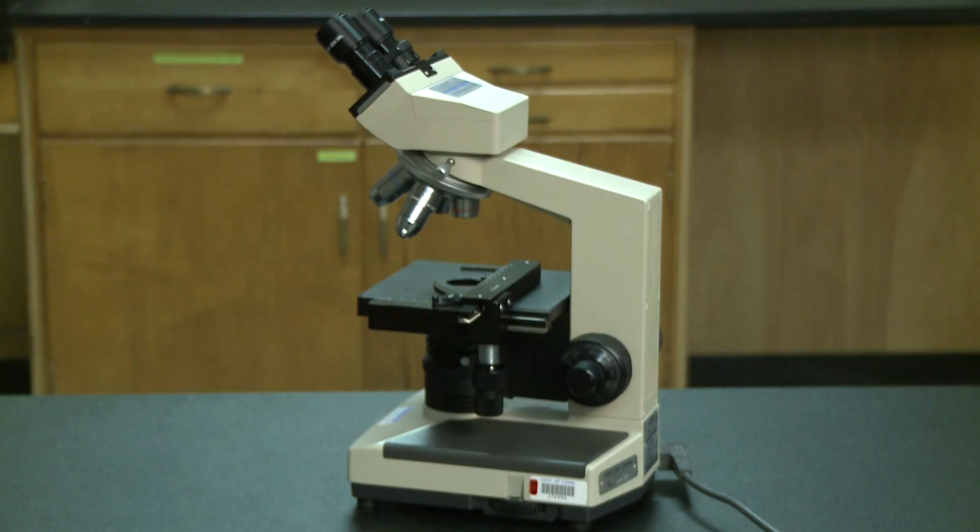Finally, if you're having any trouble focusing or viewing the slides with the microscope in the lab, be sure to ask your lab instructor for help. We hope this tutorial will be useful to you in the upcoming histology lab, as well as throughout the labs in this course.